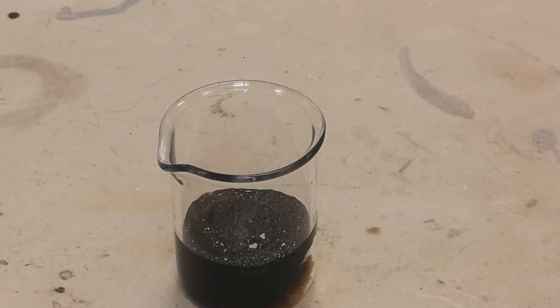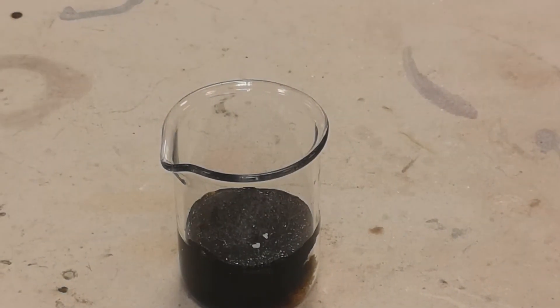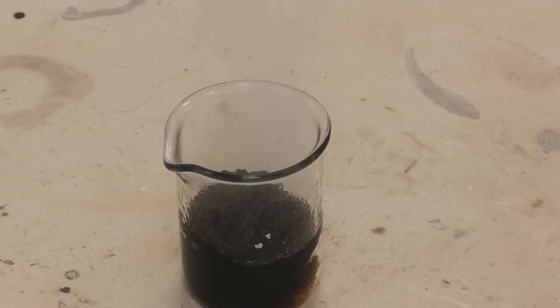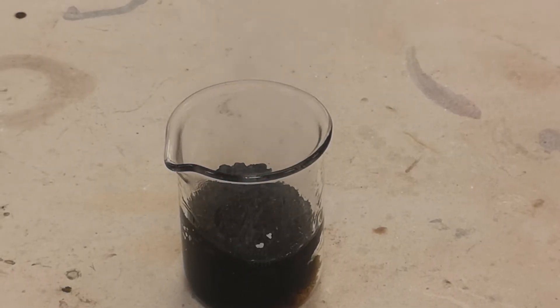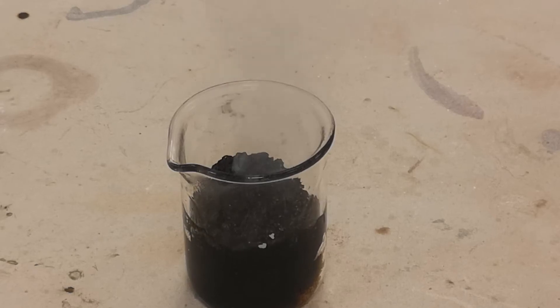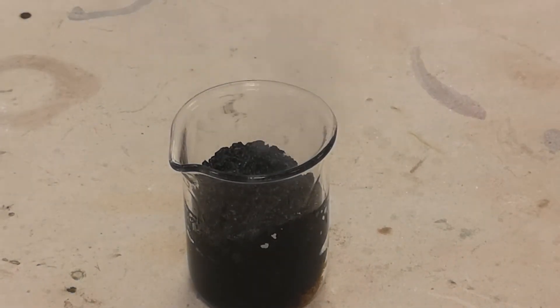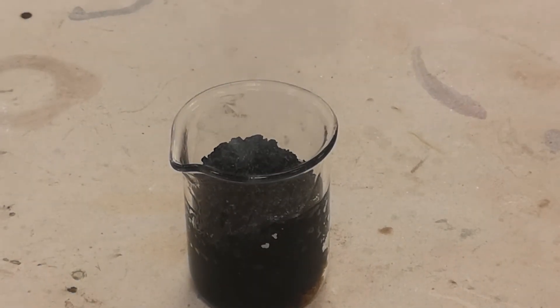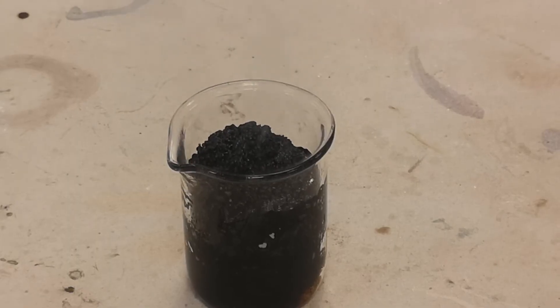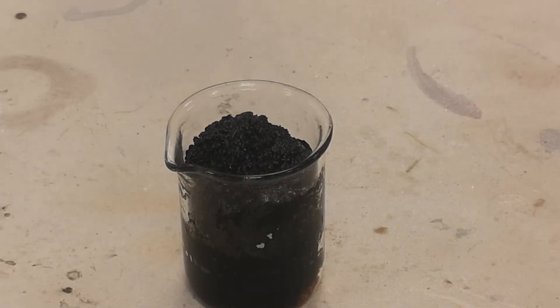But then, after about three and a half minutes in this case, the bubbling becomes more intense and you see fumes starting to come off. And then, slowly, a column of porous black solid rises from the surface and out of the top of the beaker.